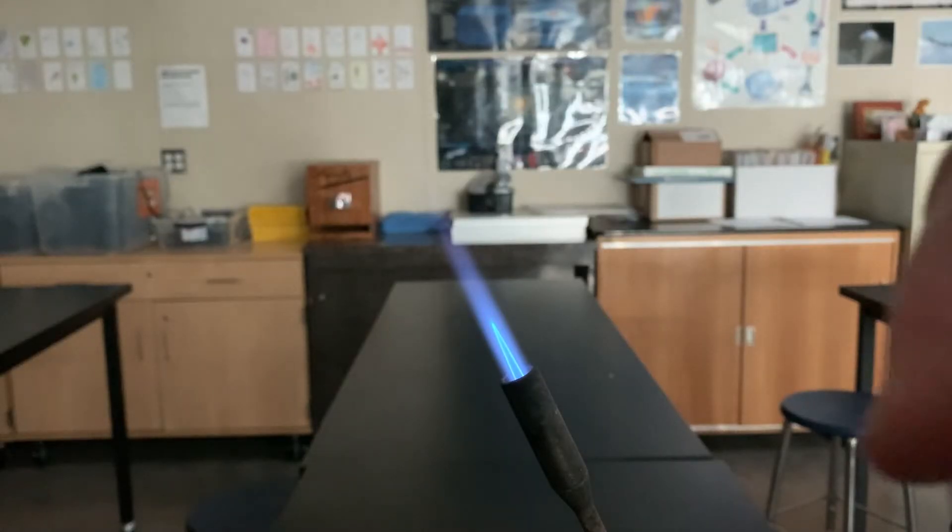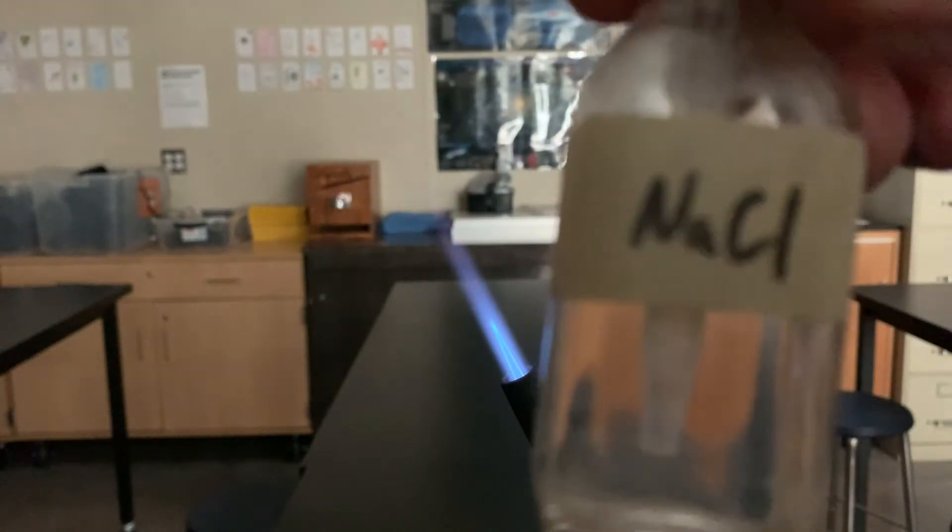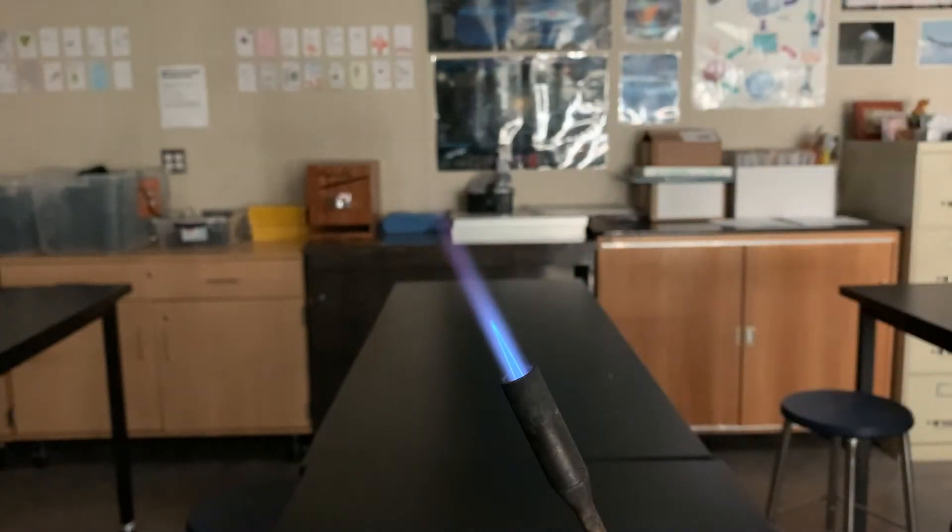This one is sodium chloride, which is basically salt water.